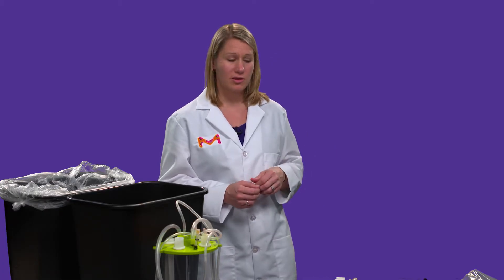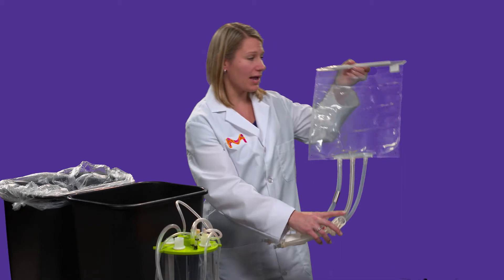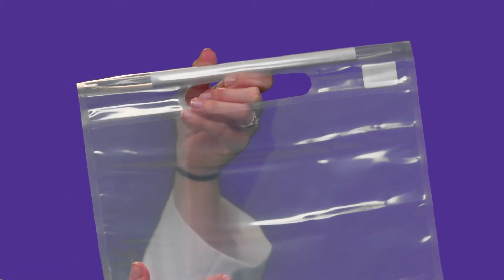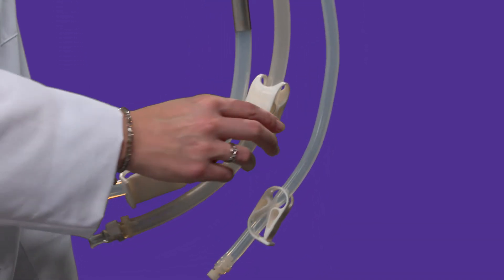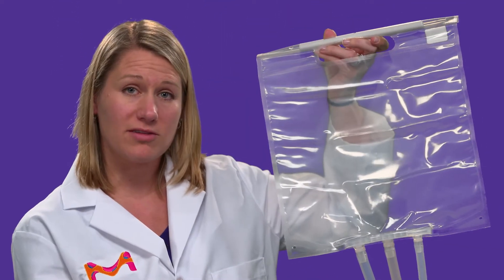Going a step above that, we have what we call a single-use assembly. This is going to be a pre-packaged, pre-assembled assembly. In this case, we have a plastic bag — a five-liter bag — some silicone tubing, and then some end connections and clamps. This comes pre-sterilized and ready to process.